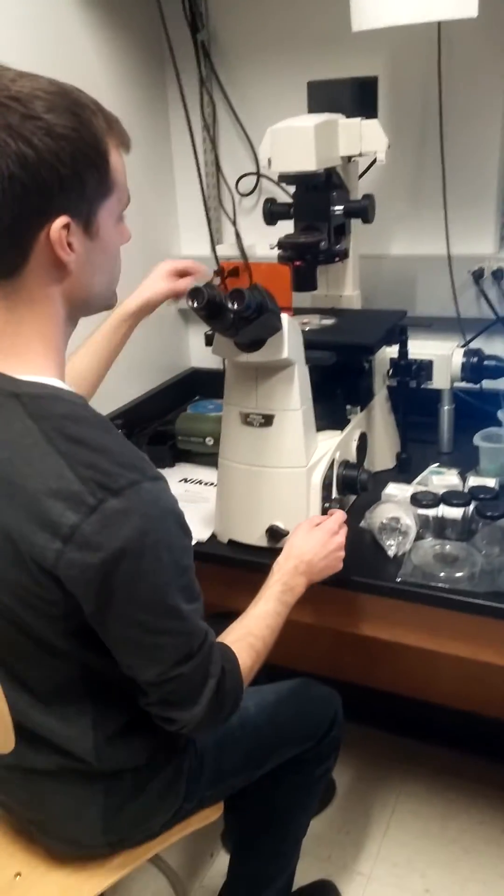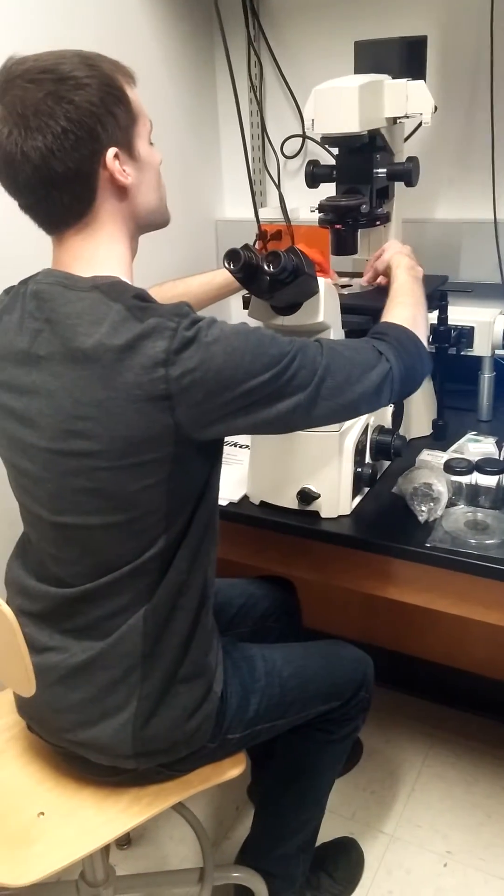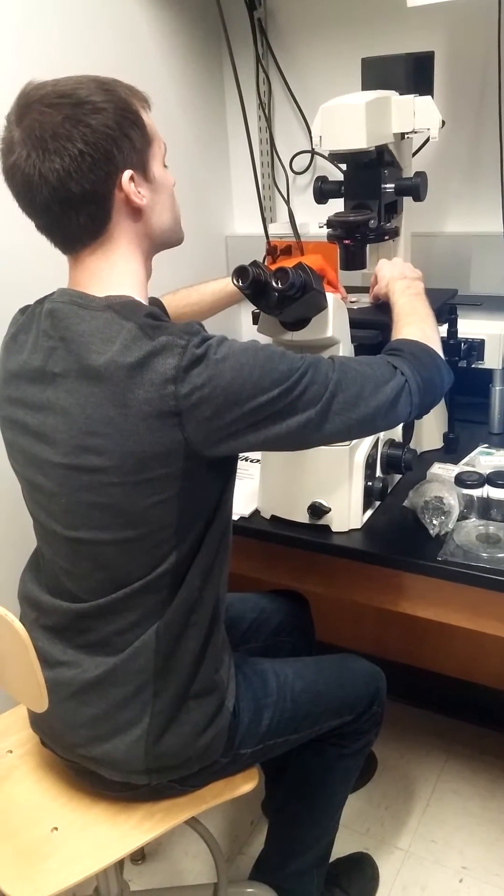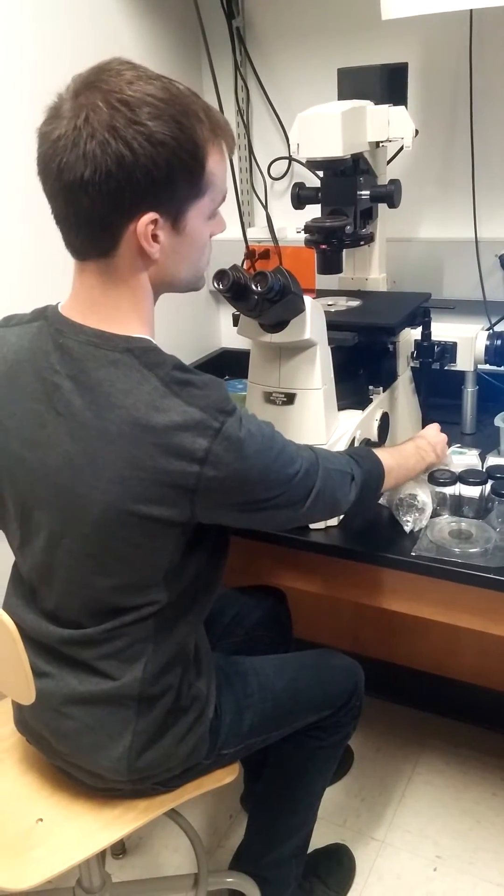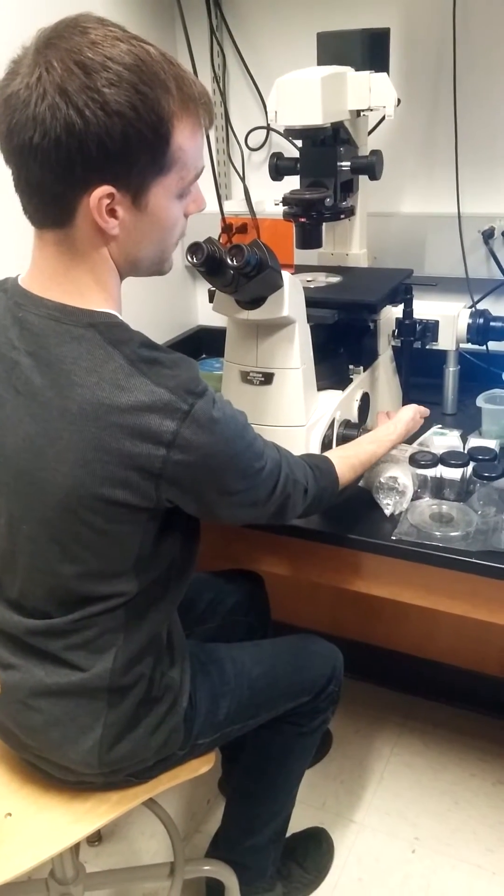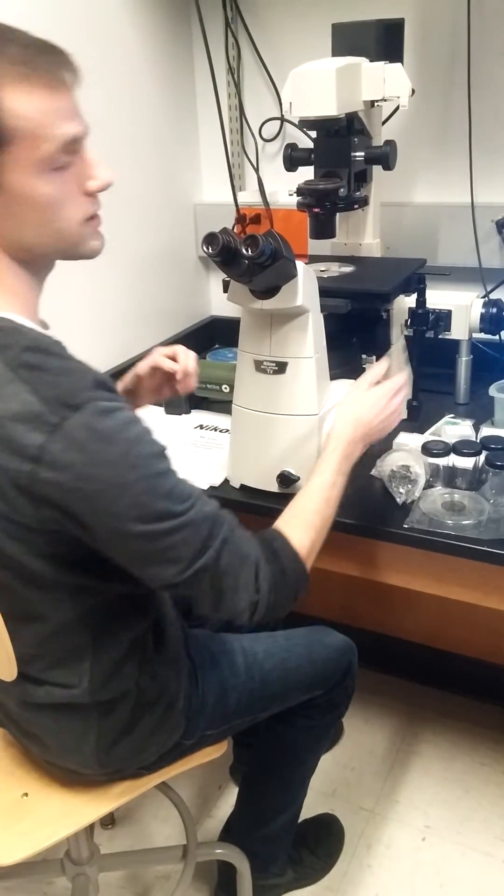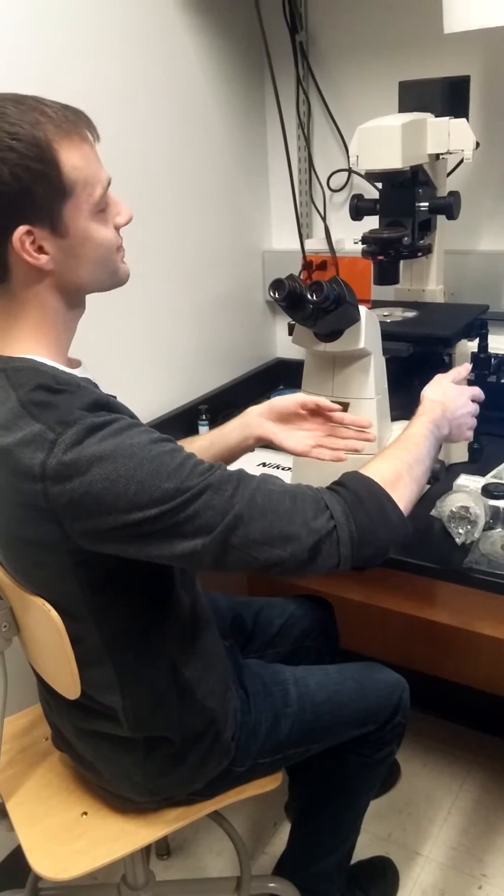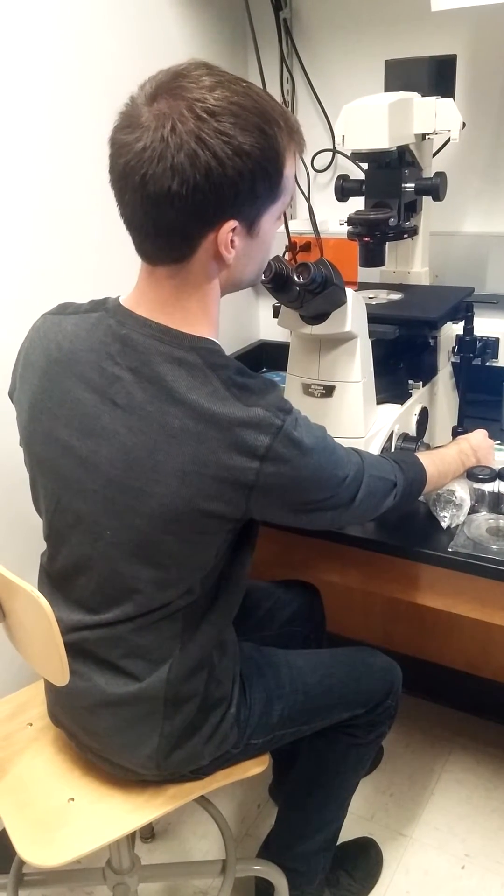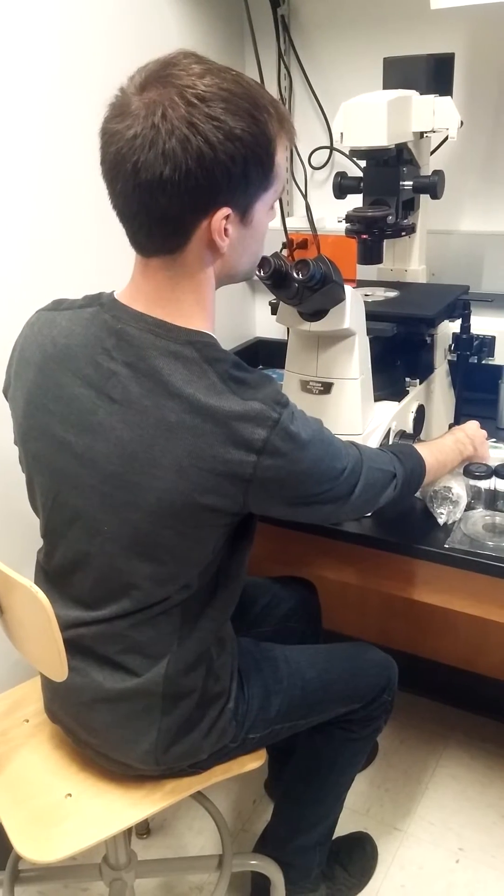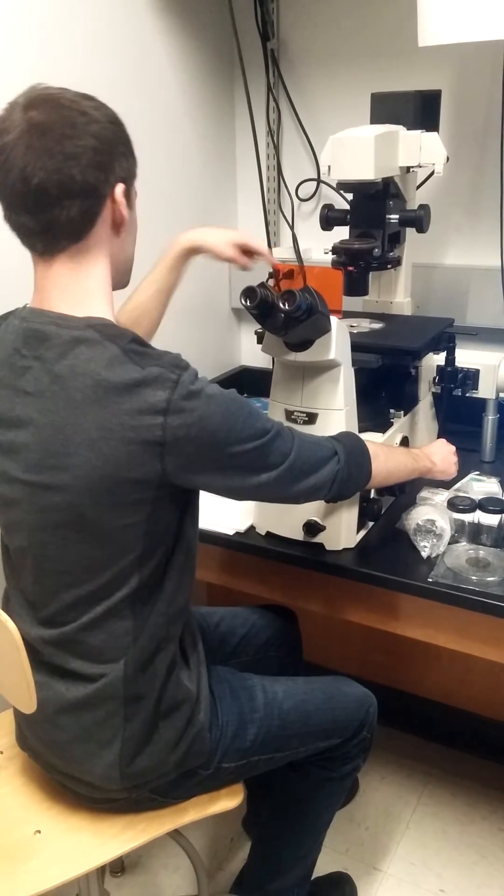To get my specimen here, I'll just use a slide in place. I'm going to put it in the center of the stage and adjust the stage position by rotating the wand here. There's a top portion and a bottom portion. The top hand side adjusts the Y direction and the bottom portion adjusts the X direction on the stage. So you'll see the stage moving up and down.